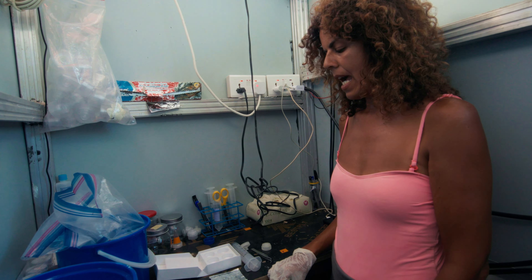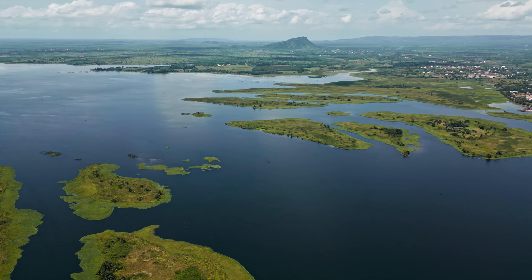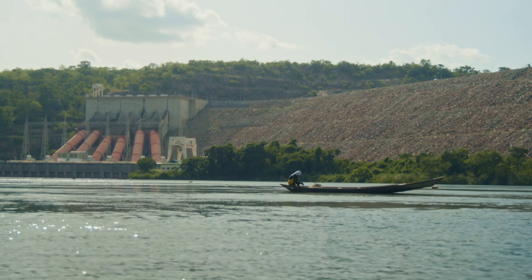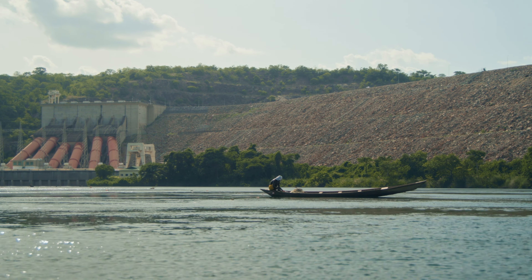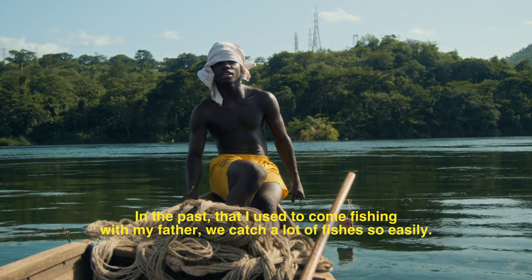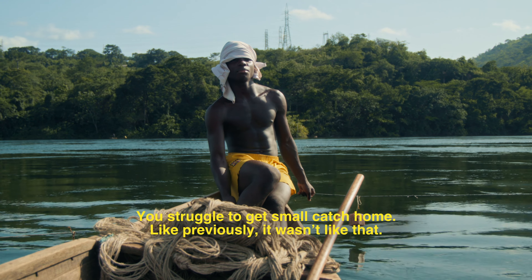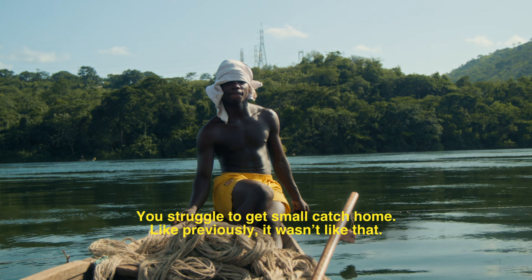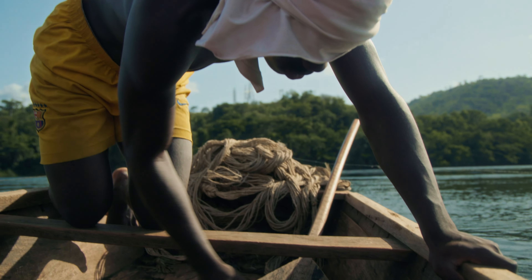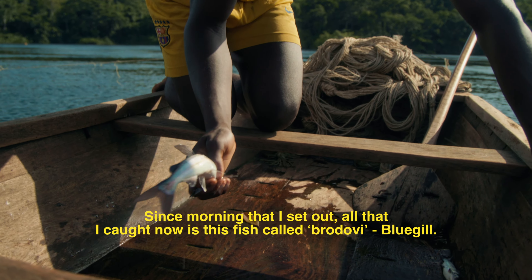We take the sample through a filter. Then the sample is going to dry in our drying case. After drying, it will go to the microscope to get microscopic images so we can do the counting of the microplastics.